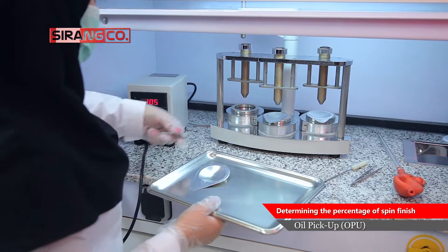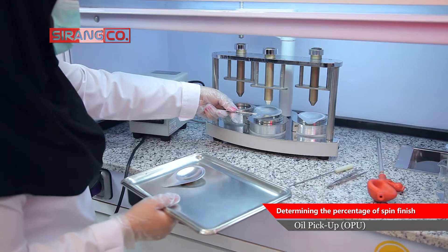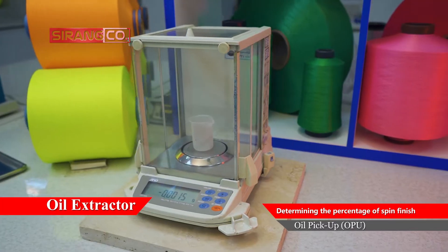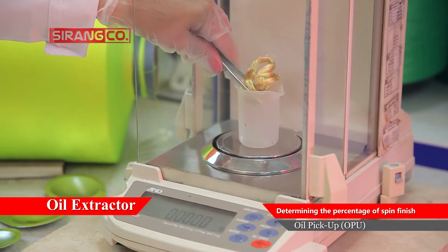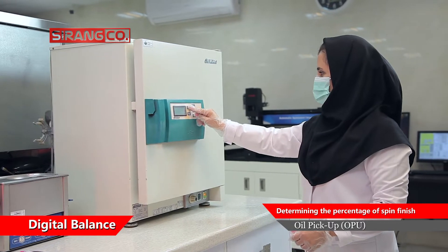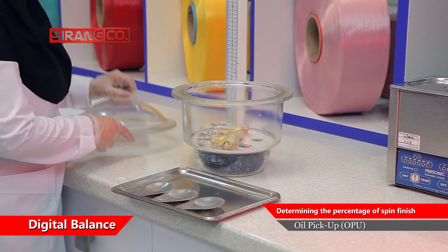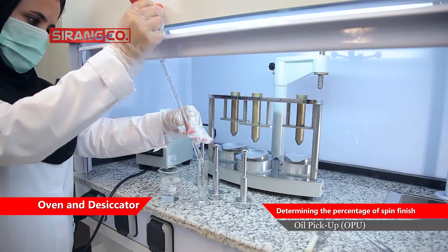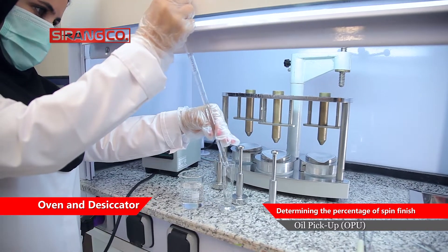To determine the spin finish oil percentage, an oil extractor and an appropriate solvent for oil extraction, an analytical balance sensitive to 0.1 milligrams for weighing, and an oven and desiccator to dry samples are used.